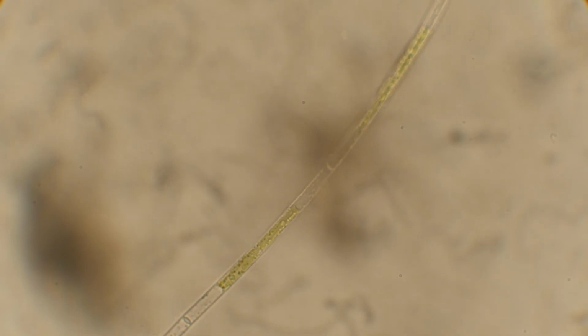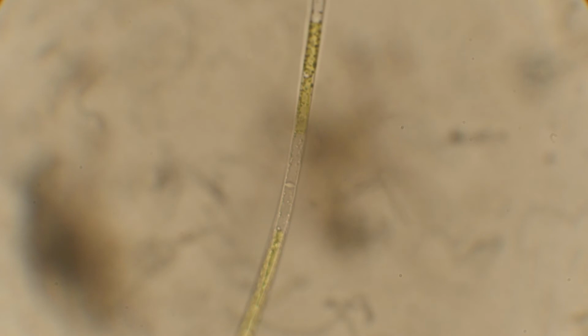So, it seems to me that that was my problem, that the sensor of the camera was too high up, so that was causing some additional magnification, and then this, what they call chromatic aberration. So, I do have to clean, as you can see, the MTV3 built-in lens. Interesting that it has a lens in it. And I can remove that lens. Maybe I'll try it without the lens as well.